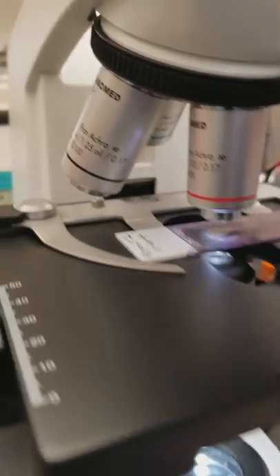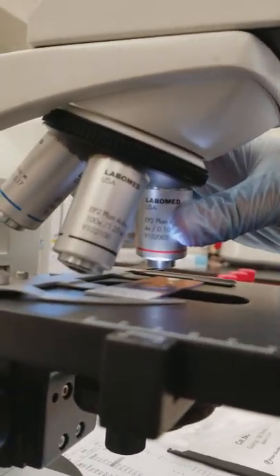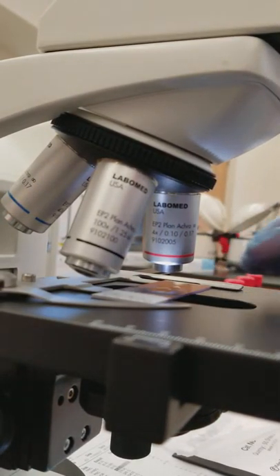So that even if you move it fully into place, the 10 is not going to be anywhere near the oil. That's how we get the most common problem of having oil on our 40.